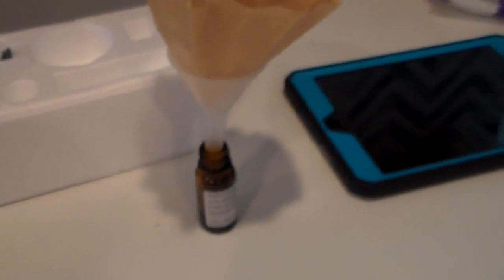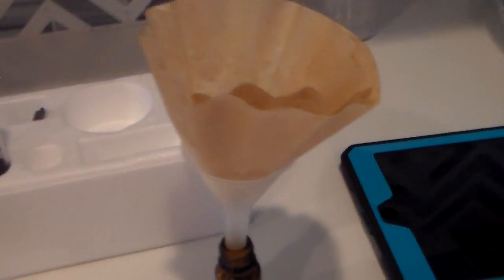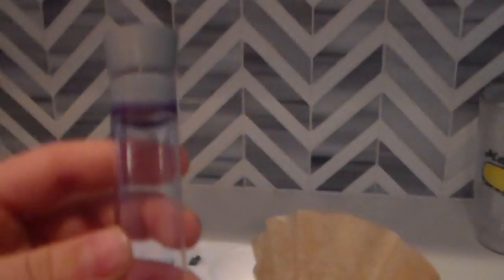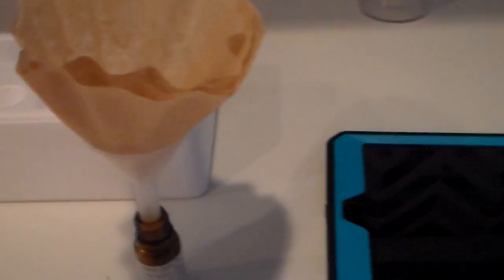I have the litmus solution to your left, and right here I have a coffee filter going into a little bottle to hold your litmus solution in. You have to get rid of that litmus powder, so that's why we have that coffee filter right there.